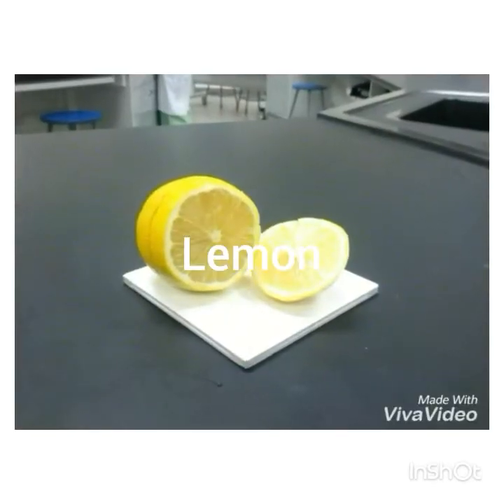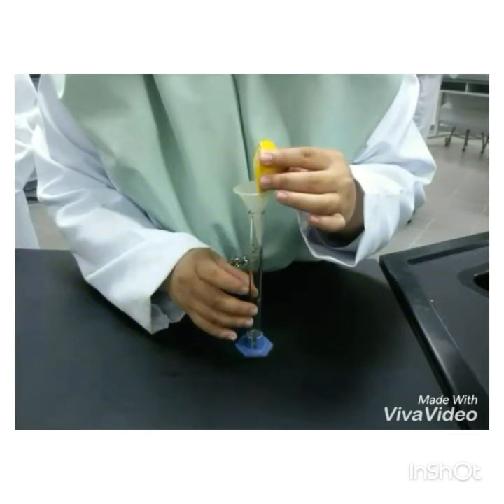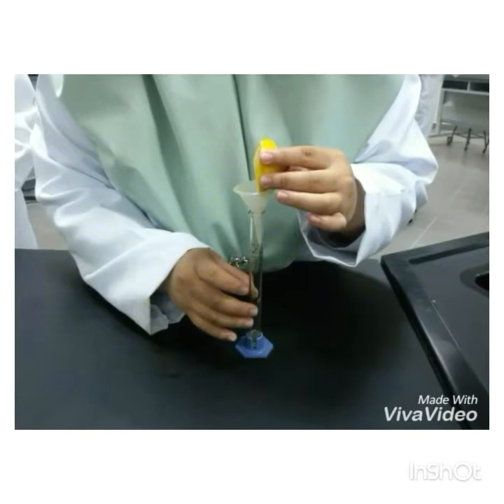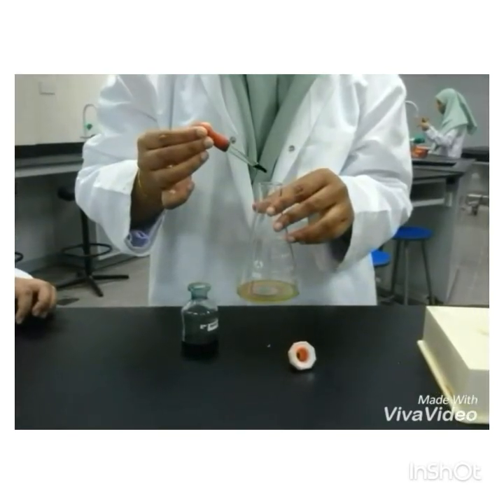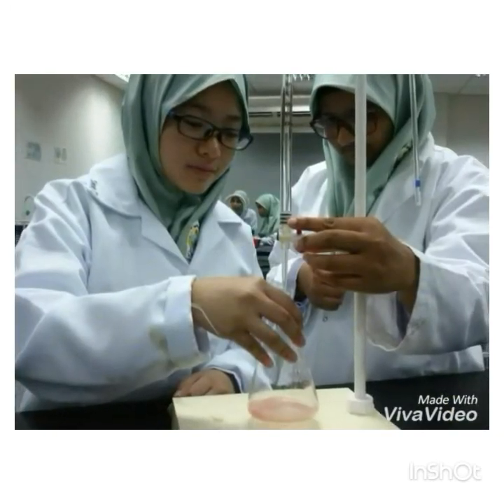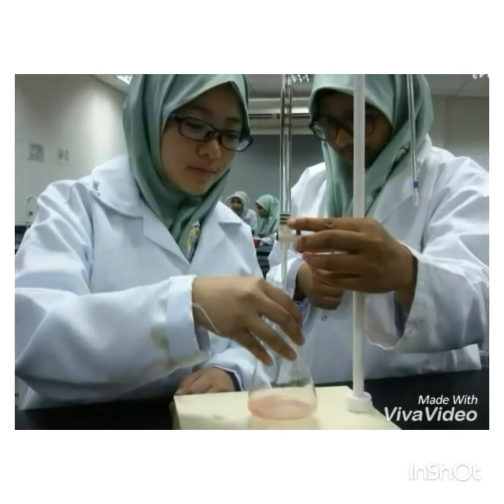First, we started with lemon. We squeezed out 5 cm cube of lemon juice into the measuring cylinder, then to a conical flask. We also added 4 drops of indicator into the lemon juice. Next, we added sodium hydroxide, which is NaOH, into the burette up to 50 cm cube.